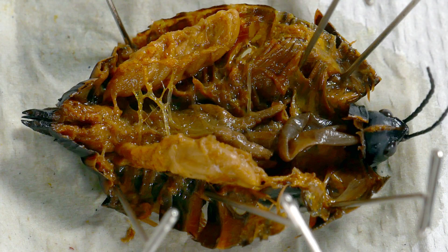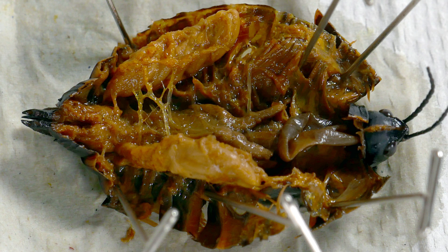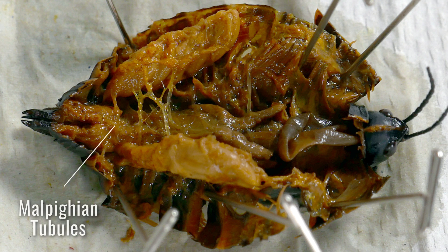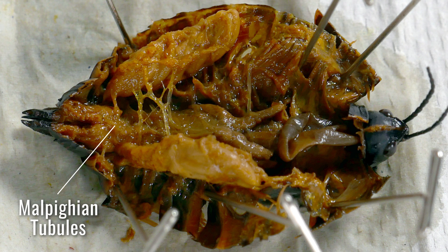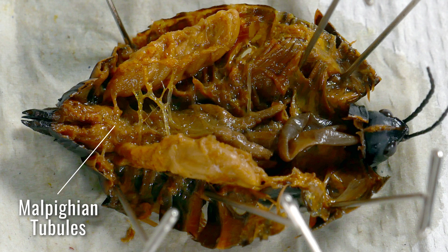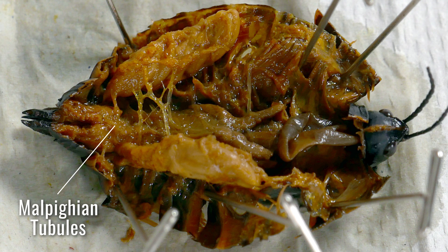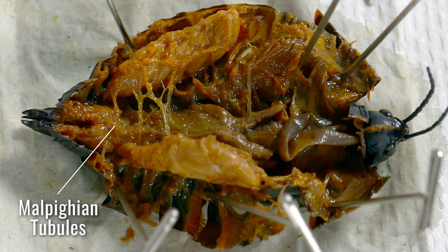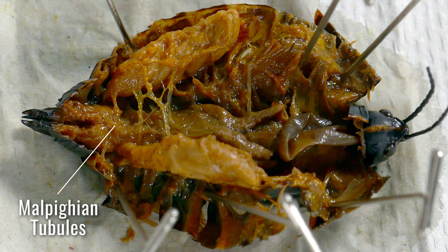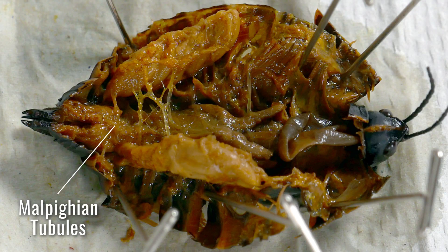Just posterior to the stomach and anterior to the large intestine are the tiny tubules that make up the excretory system, called the Malpighian tubules. These structures function in a similar fashion to kidneys by removing metabolic waste. Eventually, the metabolic waste from the coelom is transported to the anterior end of the large intestine and removed with digestive wastes. Take a picture and label the Malpighian tubes.